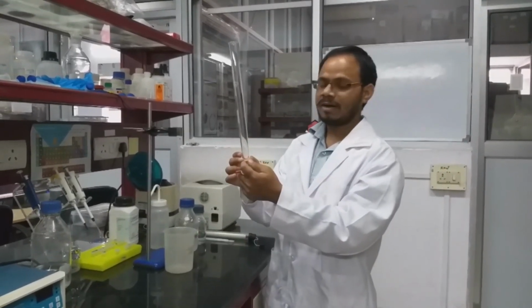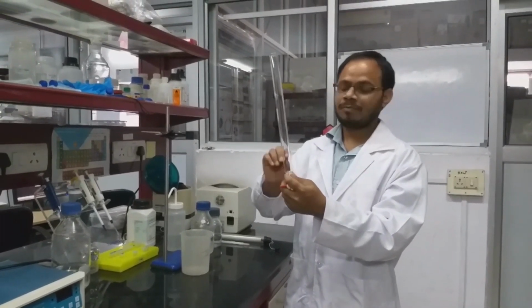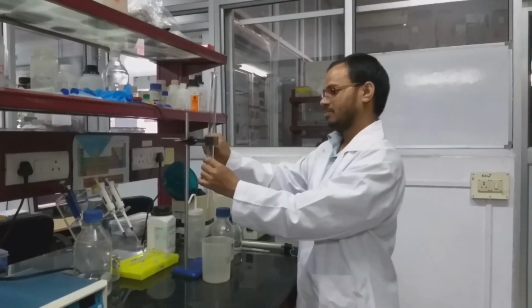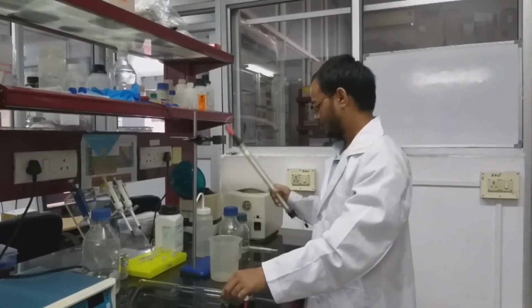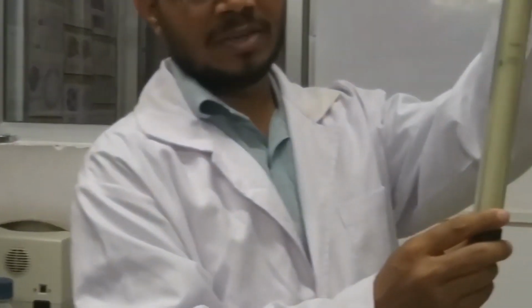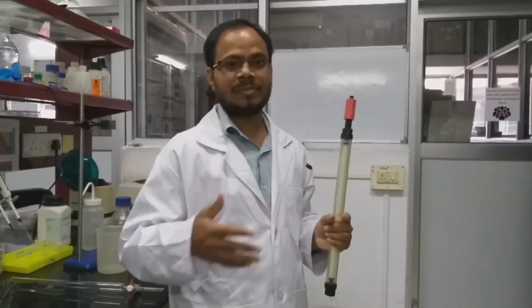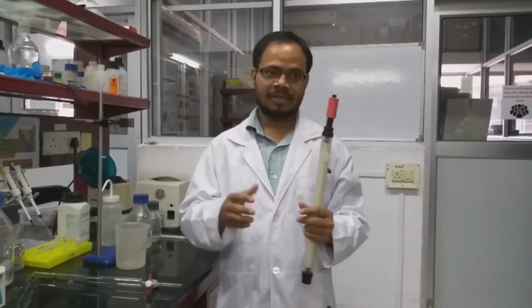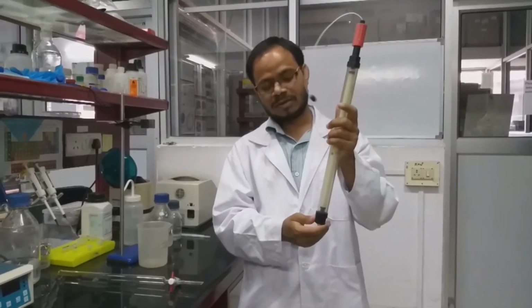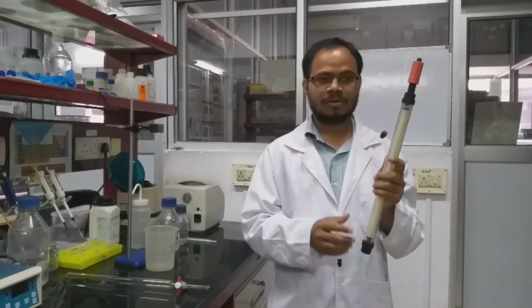At the bottom of the column in pre-packed columns there is a sintered filter, which prevents the beads from going through the outlet. Here, if you see, in pre-packed columns there is a sintered filter at the bottom of the column. Outlet and inlet both contain sintered filters. At the inlet, which is mainly for buffer, any particles which would obstruct the flow are separated on top. And the outlet one prevents passage of the beads through the outlet.